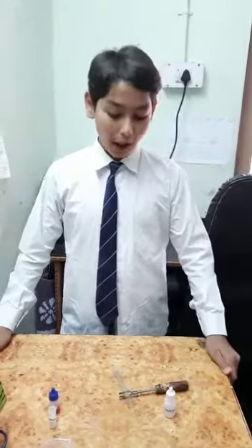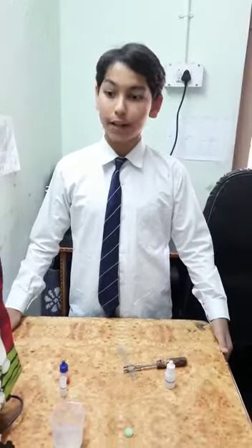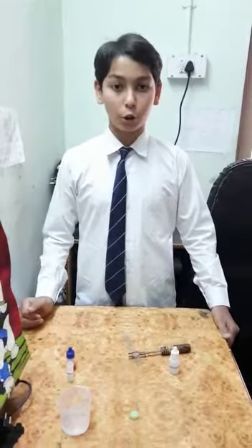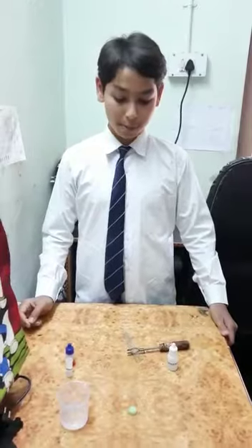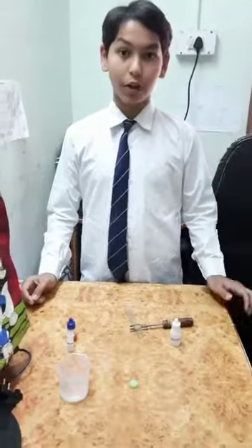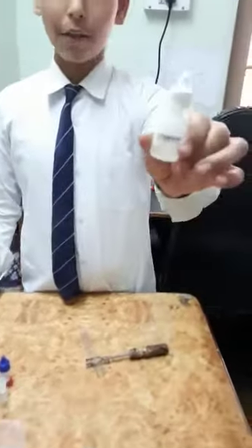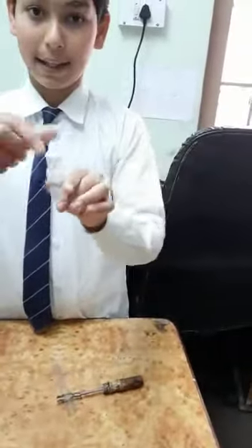Good morning everybody, myself [name], seventh grade. Today I am going to show you a science project known as neutralization reaction. It is also known as double displacement reaction. For this reaction we have our HCl.